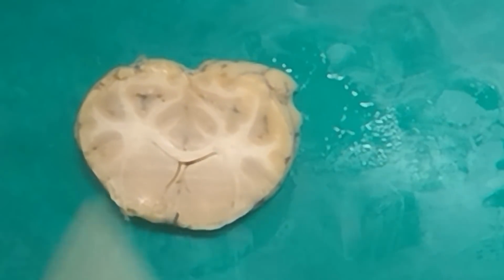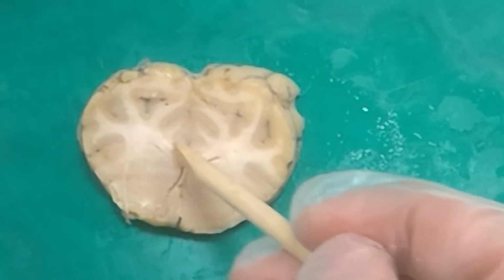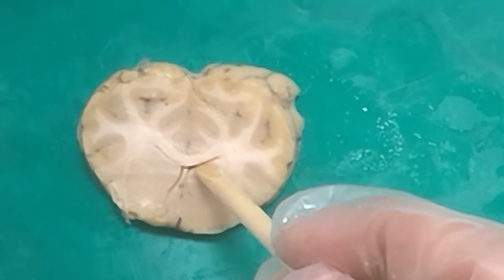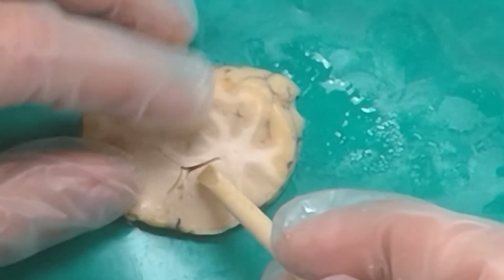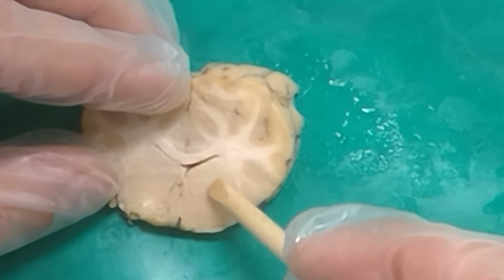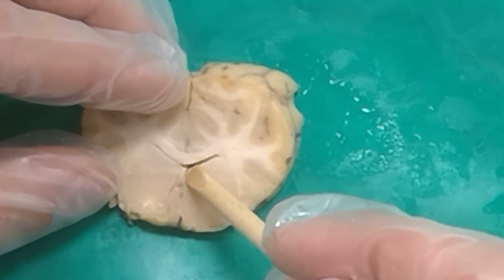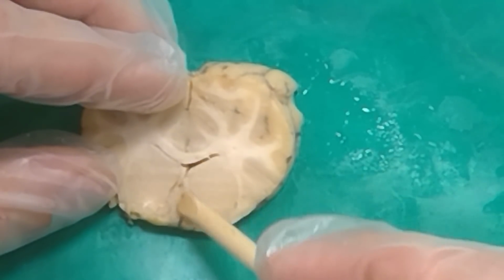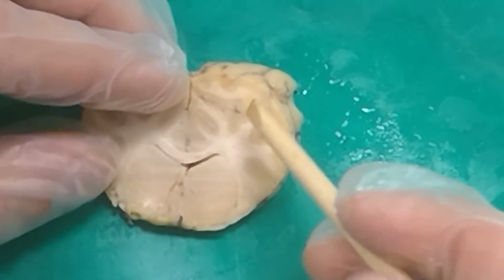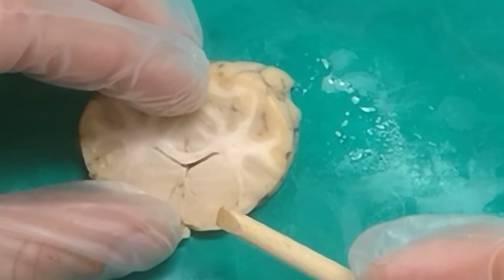All right, so we've gone a little farther back. So again, what do we call these white fibers up here? And the gyrus just above that? And the space inside the brain below the corpus callosum? Lateral ventricles. Now we've got these white fibers that are running right here. Internal capsule. Right, and so just medial to those white fibers is the caudate, and then just lateral to those white fibers on this side, putamen. If I was owning a neuroscience hotel, I would call it the putamen.